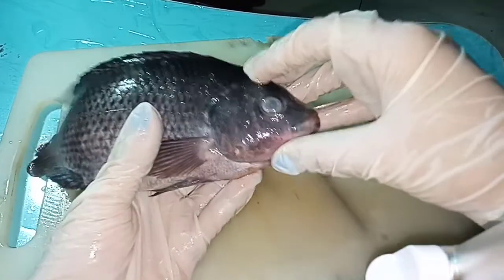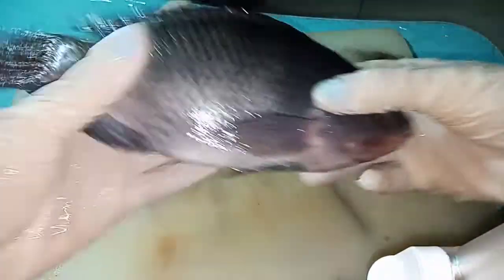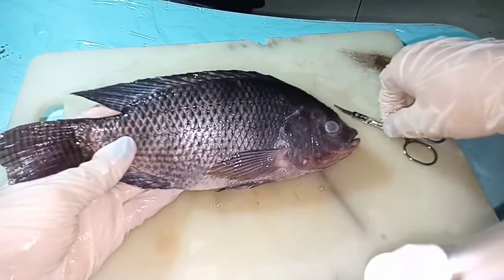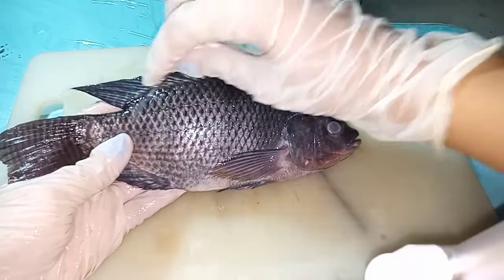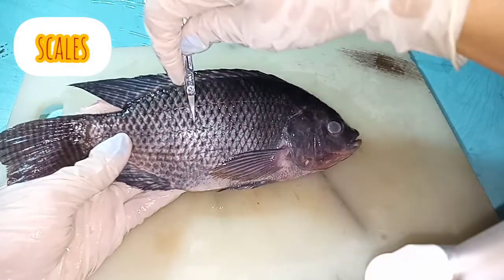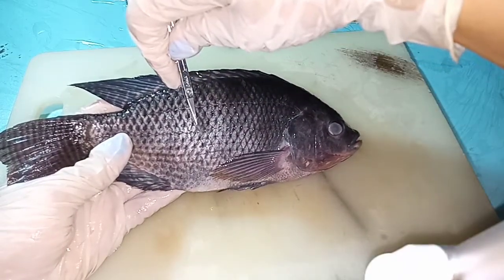This is the head region. Next is the trunk region. The first thing we will see is the scales — it still has scales.